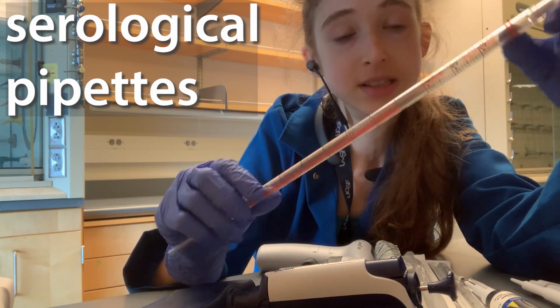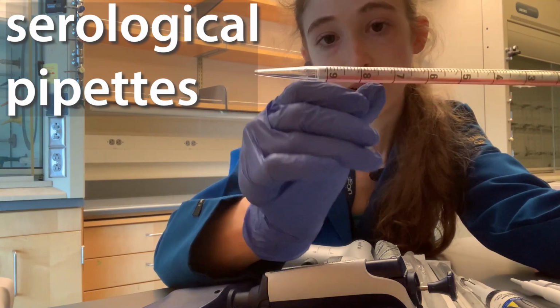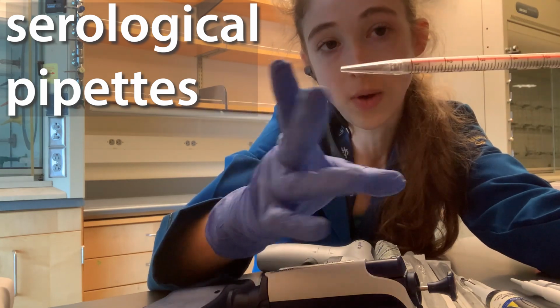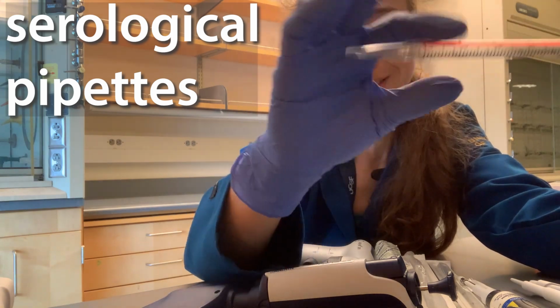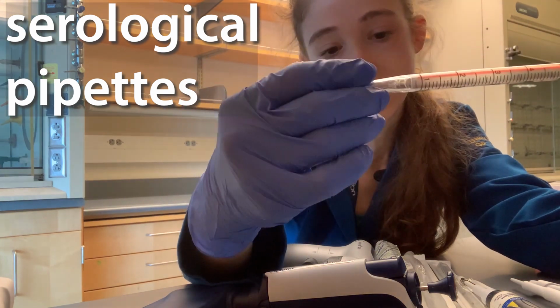You can also see this is a blowout pipette, which means that from 9 to the bottom, it looks a lot longer than these. That's because it's narrowing down. And so when you deliver with these, you're going to actually blow everything out of the tip. Because it's narrowing down, you're going to have a longer volume to push things out.